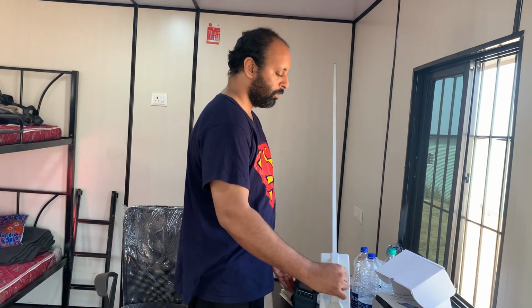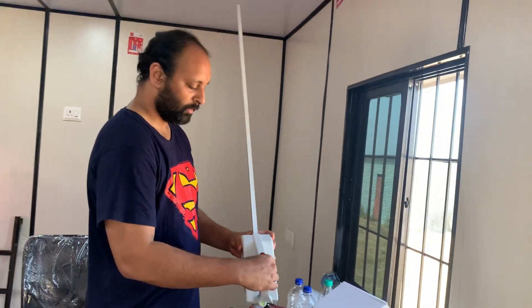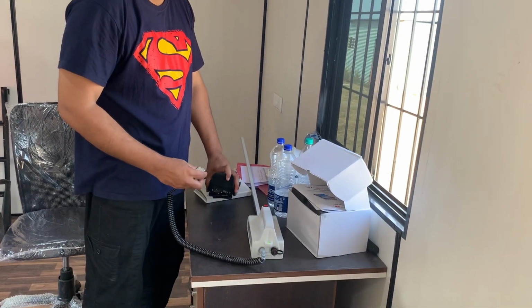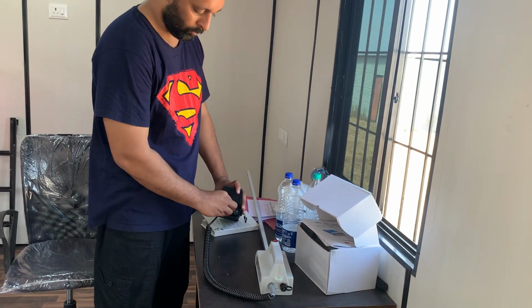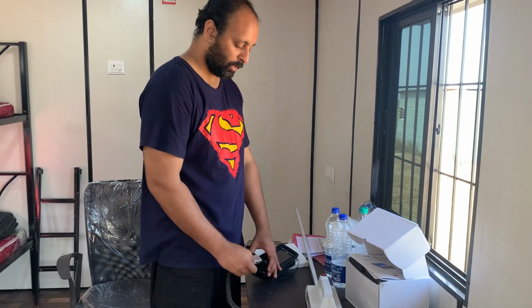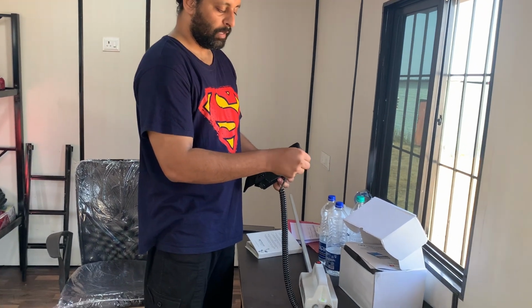You can see this rod, which is like 1 meter long, and this is the functional button of this device. Using this cable here, I'll add one thing, that red button is like the enter button. So wherever there is the relevant menu, pressing that red button has the effect of saying enter. This is the cable through which you connect it to the PDA. The PDA is operable with your finger or by a touch pen, which is placed here.